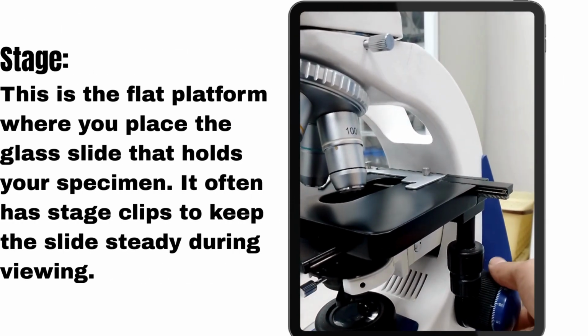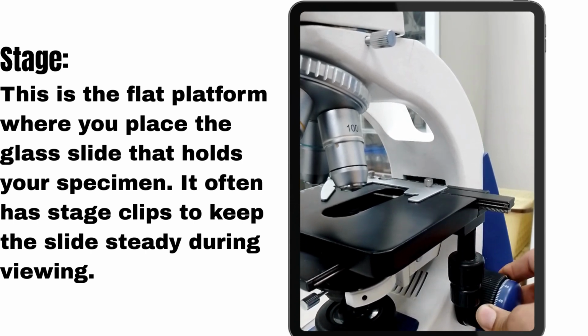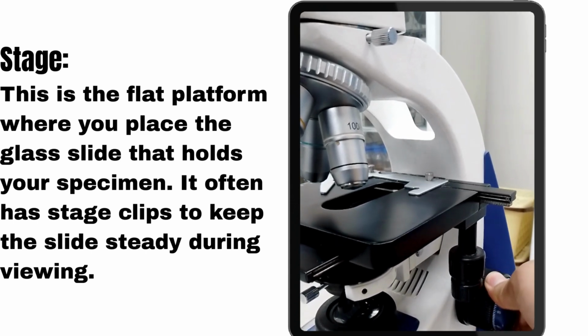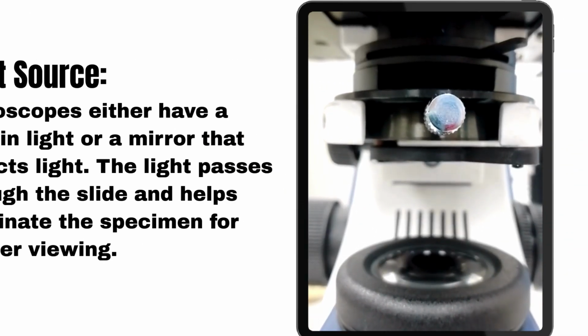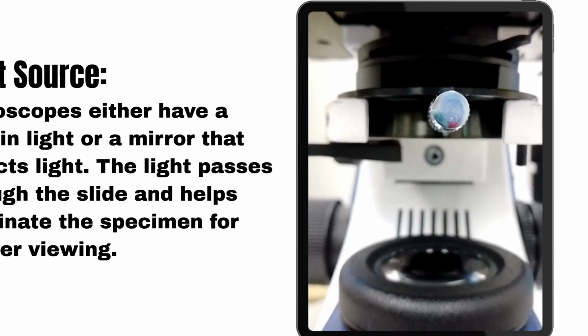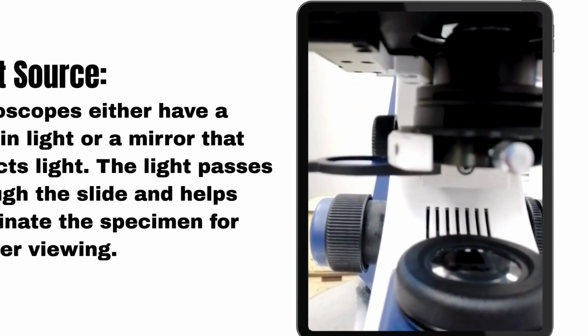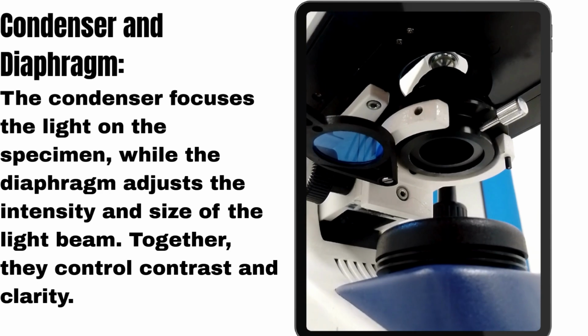Stage. This is the flat platform where you place the glass slide that holds your specimen. It often has stage clips to keep the slide steady during viewing. Light source. Microscopes either have a built-in light or a mirror that reflects light. The light passes through the slide and helps illuminate the specimen for clearer viewing.